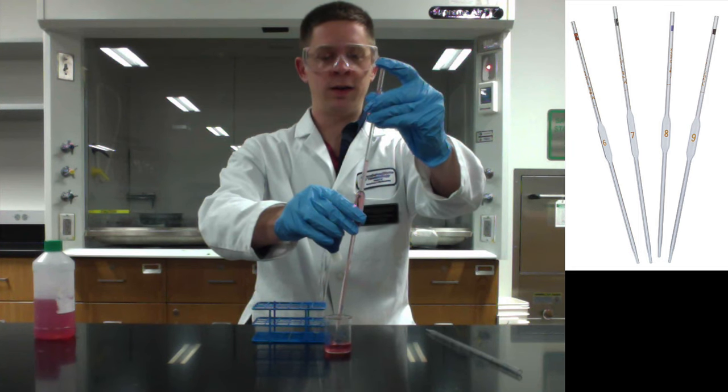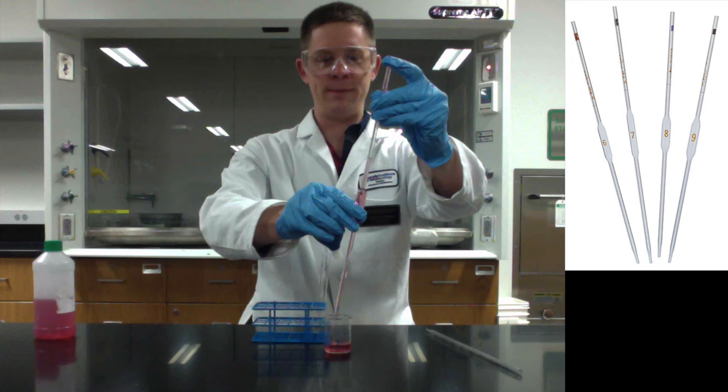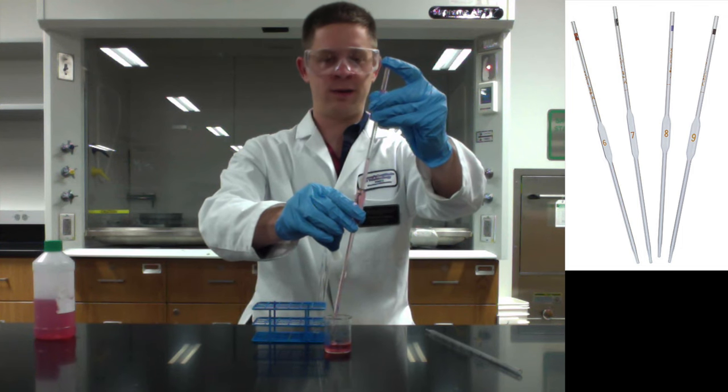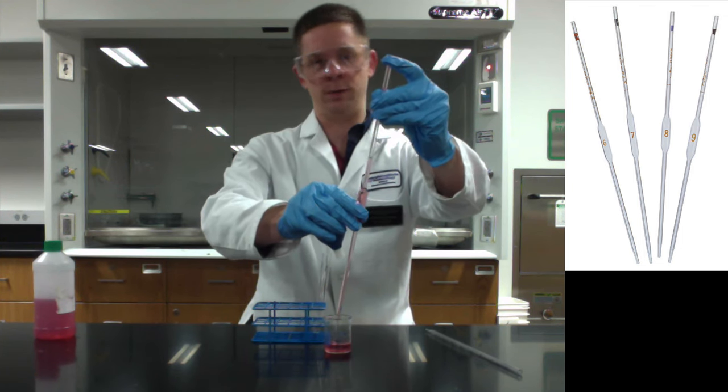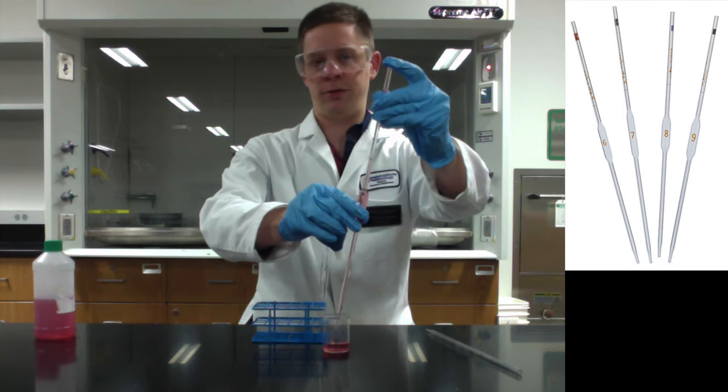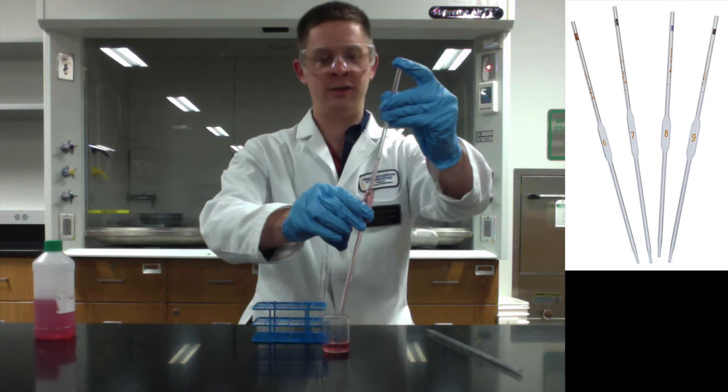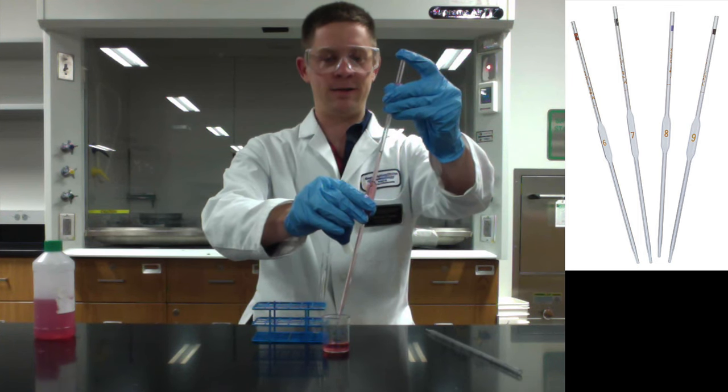So we've let the liquid come down, and this is, by the way, another reason not to pipette directly from a reagent bottle because you'll be putting back in some of the liquid, right? We pulled above the mark and we're putting back in some of the liquid. That's inevitable. So just make your life easier and the lives of everyone else in your section easier and pour into a beaker. Don't pipette directly from the reagent bottle.